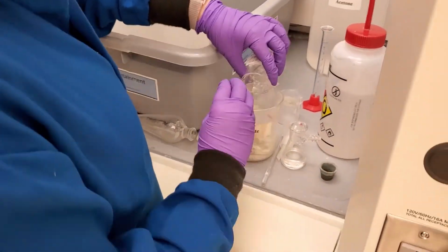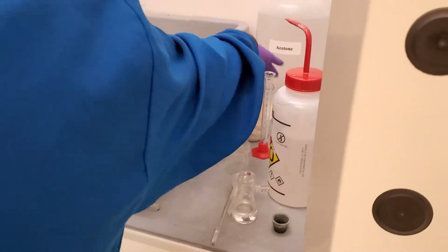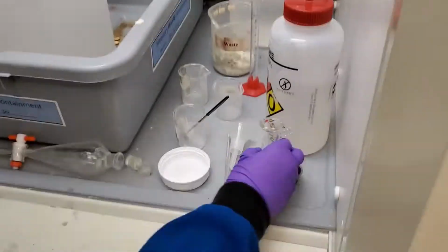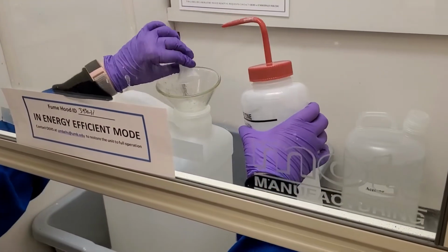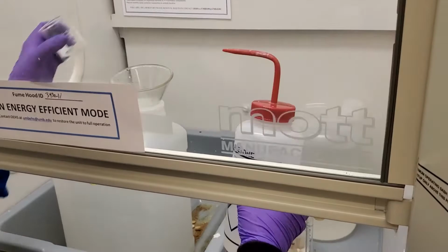To finish the day, we need to take care of our waste. The sodium sulfate needs to be scraped into the solid waste container. For the rest, we will need to open the liquid waste container and place the funnel on top. We can then pour in our filtrate and rinse our glassware, filter, and spatula with acetone into the liquid waste. When you are done, remove the funnel and recap the liquid waste container.